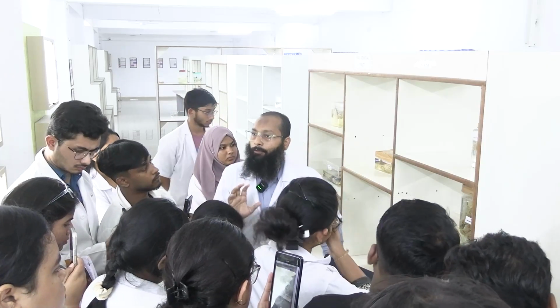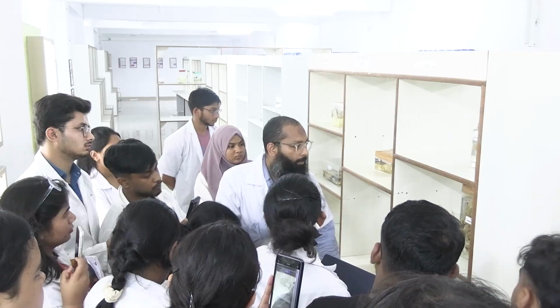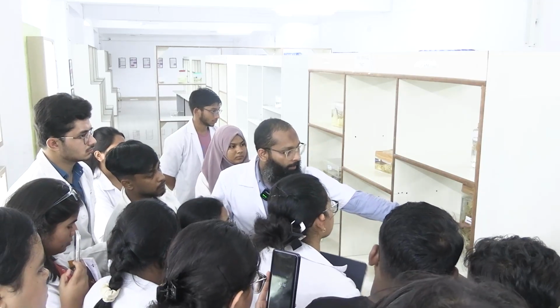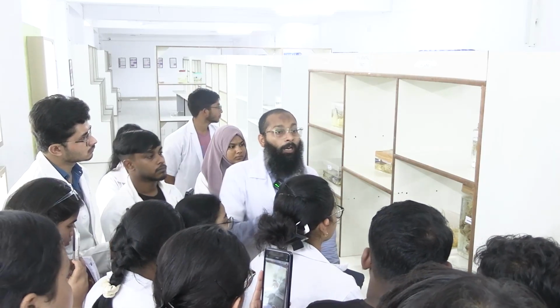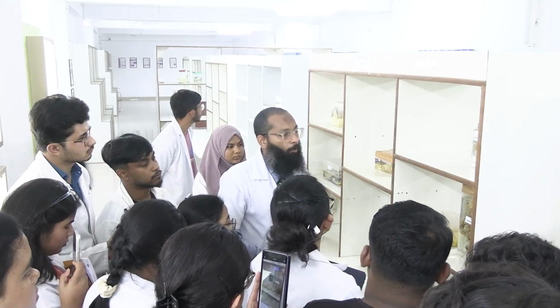Now the presence of a mass doesn't mean that this is a cancer, okay. Here it is written carcinoma breast, but the presence of a mass doesn't make it a carcinoma. There are other things you have to search for. What do you think? What are the other points?